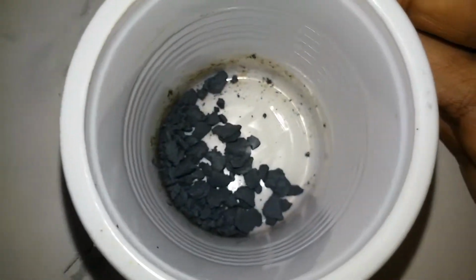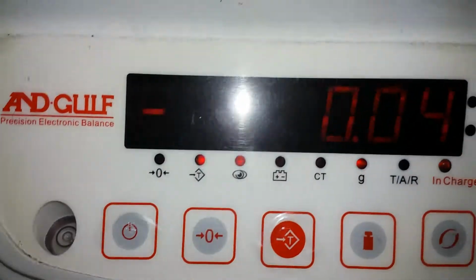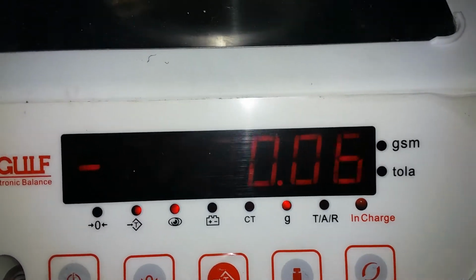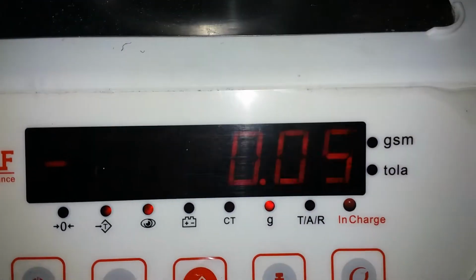Now we have our iodine, and so now we're gonna measure it. I did not extract from this, so I'm gonna do it in the morning. And I see a lot precipitated out, about maybe a gram or something. Okay, here's my scale. Let's just tare it. Just the wind. Okay. It does not matter now, because the fan's running and now I'm measuring it. So there we go.